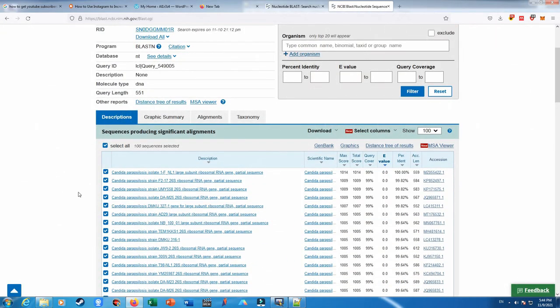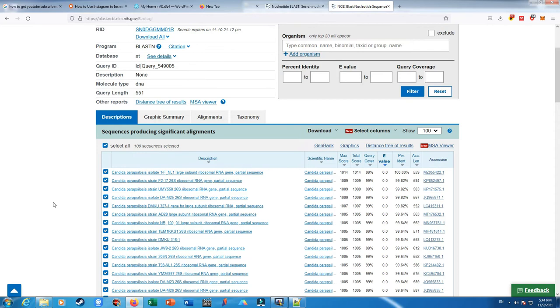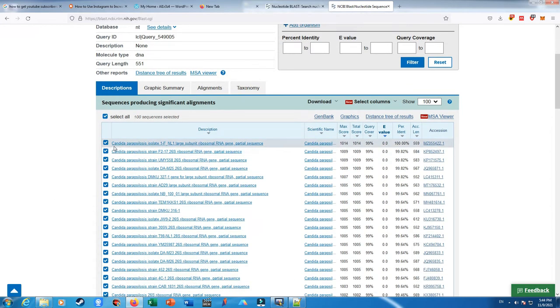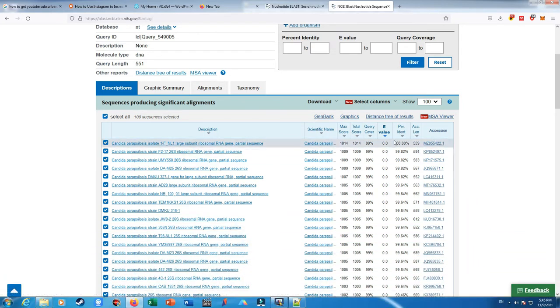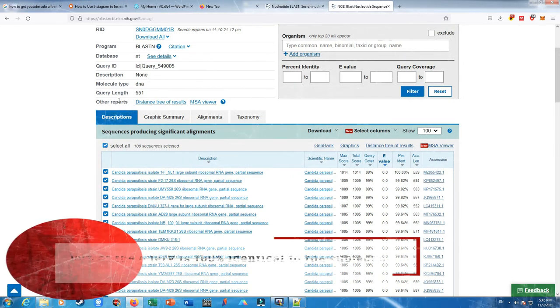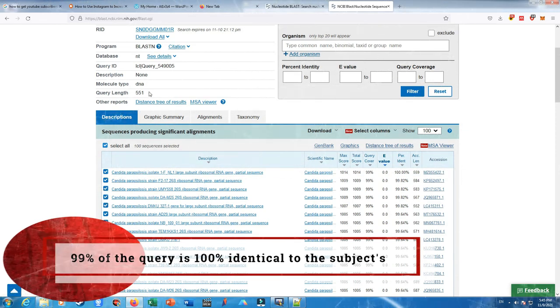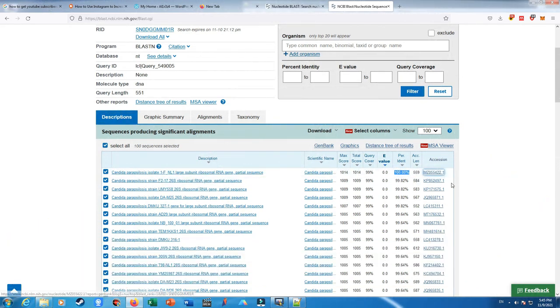Here is the result. As my colleague said to me, this sequence data belongs to a microorganism, a fungus, and we can see its name is Candida parapsilosis, if I am spelling correctly, and it has a 99% query cover, and the e-value, or expected value, of 0, which means that we have no mismatching by chance. Okay, and the identity is 100%. So 99% of our query, which might be 548 or 549, is identical at 100% to the NL1 large subunit ribosomal RNA of this entry in here, which is highlighted by this accession number.